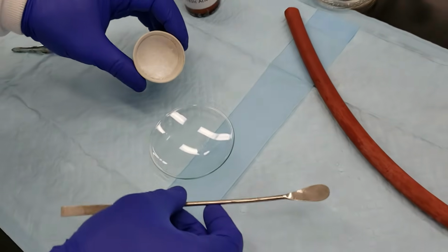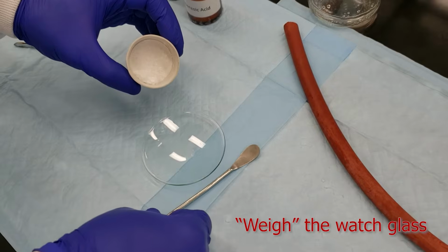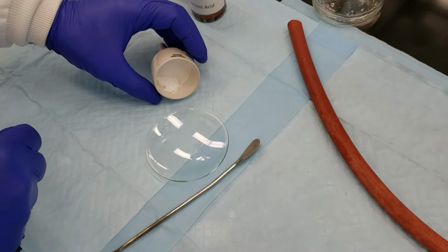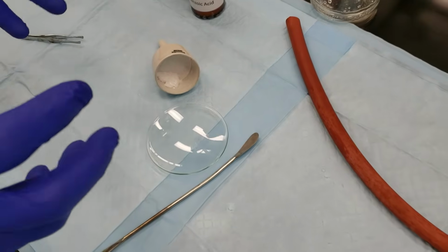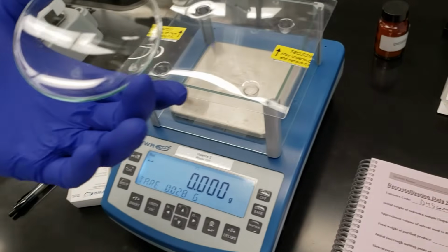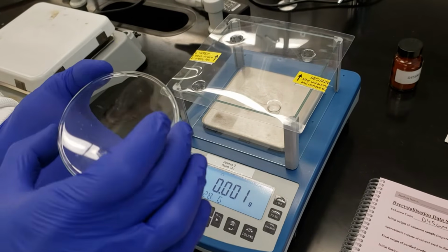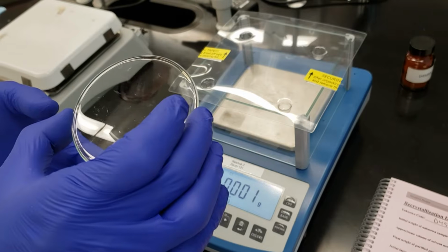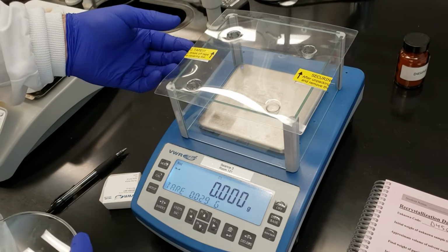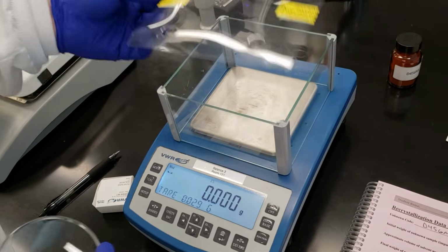Now before I actually scrape these off and put them onto the watch glass, we need to tare the watch glass to make sure we know what its weight is, so that we'll know exactly how many grams of crystals we've recovered. So this is the watch glass that I'm going to use to collect our final crystals. I need to get the weight of this before I scrape everything onto it. So I'm going to make sure that my balance is tared. There we go. Take off the top here.